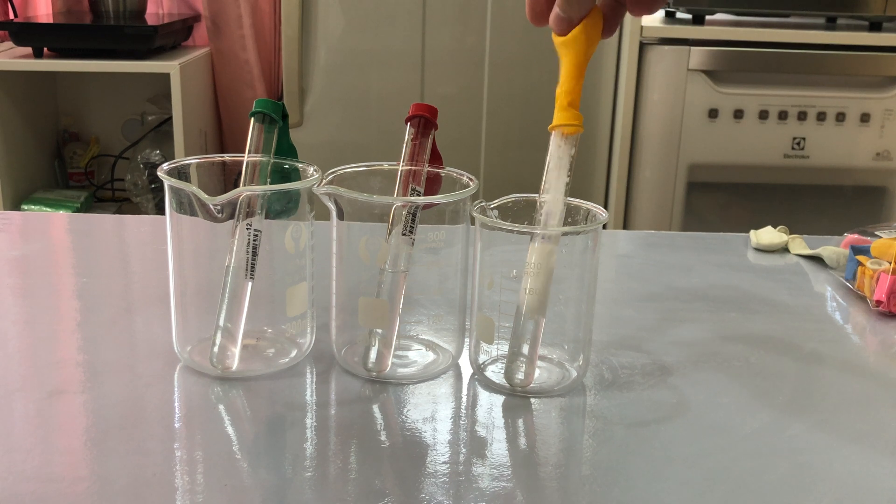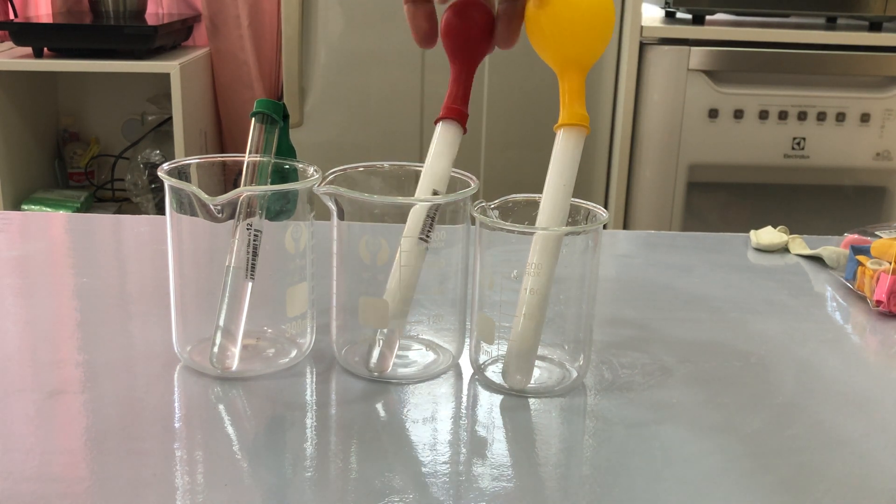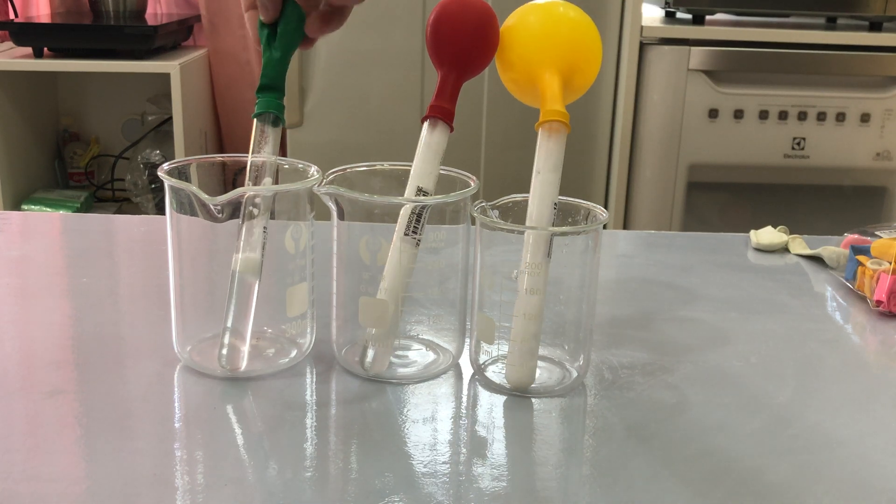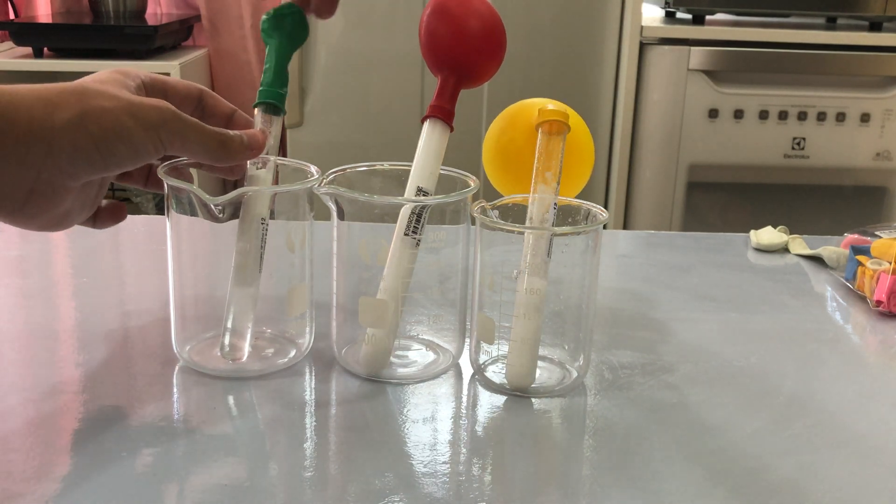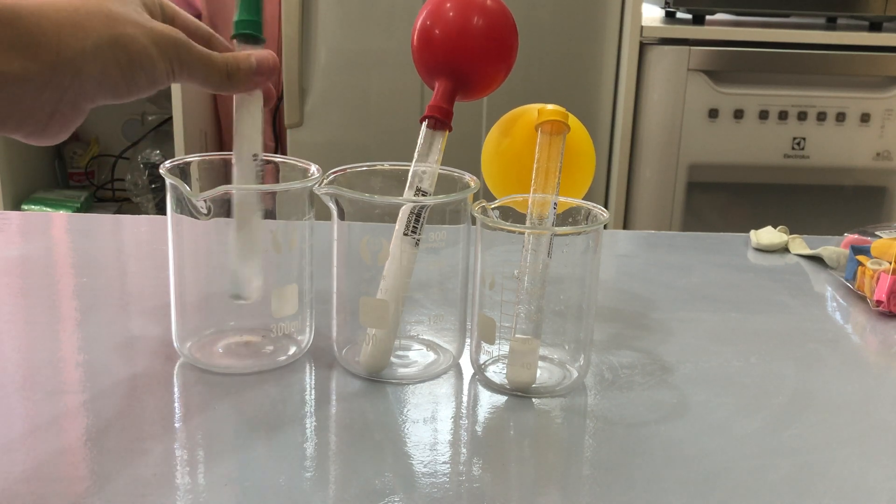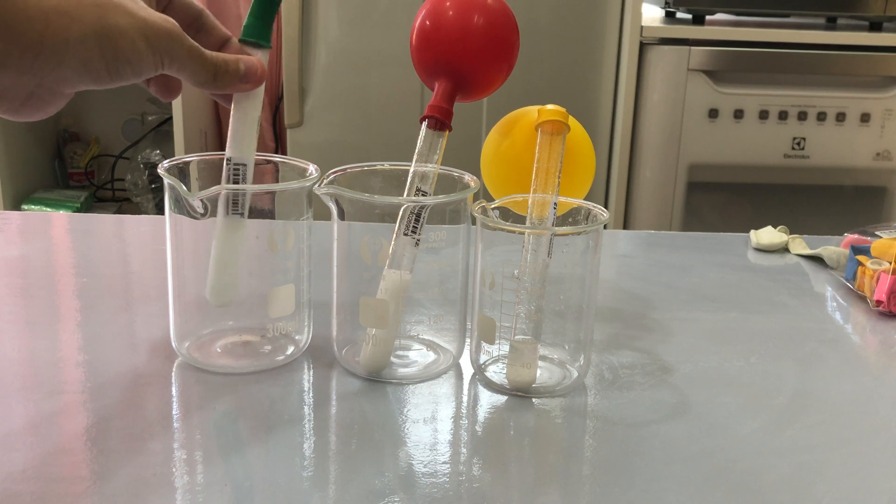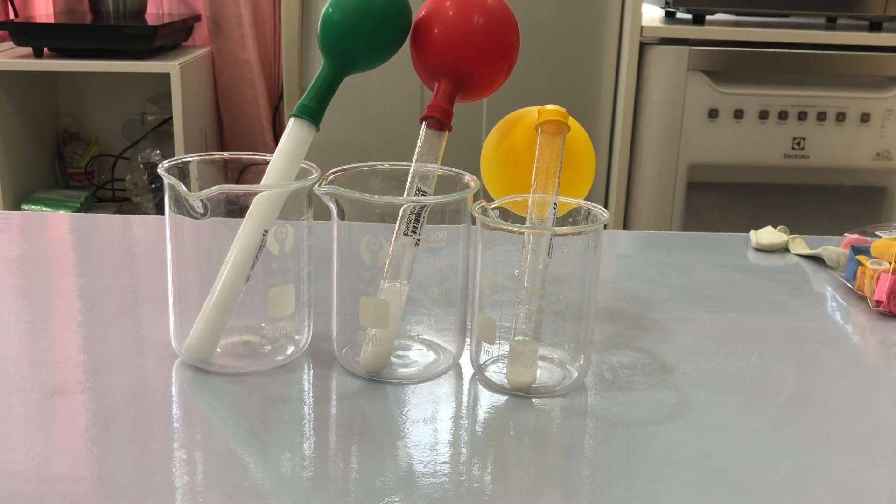And it's time to start the experiments. Raise the balloon up and let the sodium bicarbonate fall inside the test tube and react with the acetic acid. We will have carbon dioxide inside the balloon.